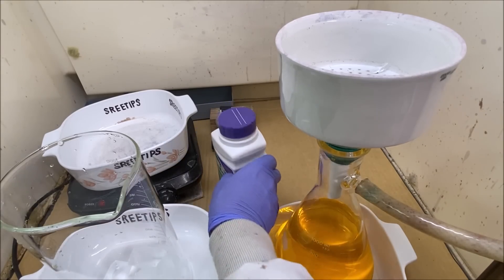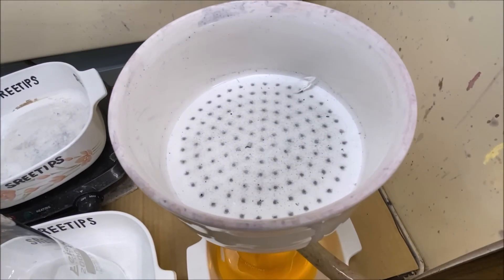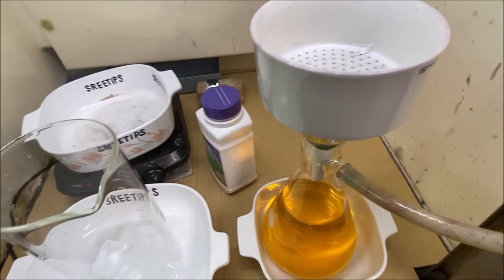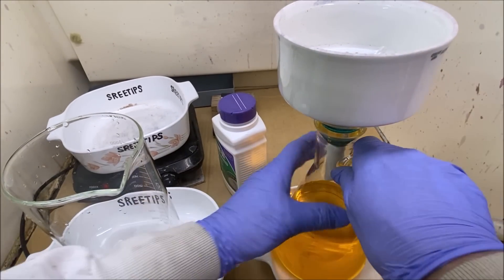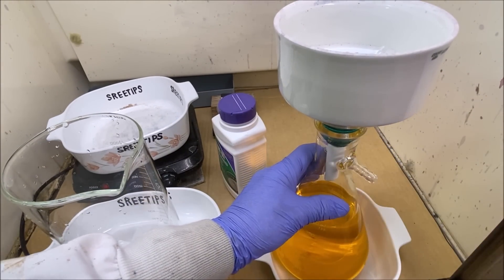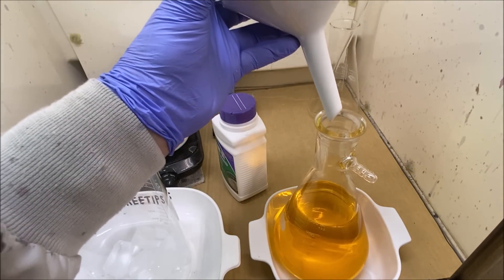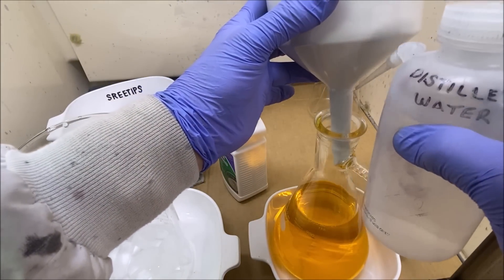As you can see, we've got some junk that we filtered out. So what we'll do now is we're going to get our gold solution into a clean beaker.